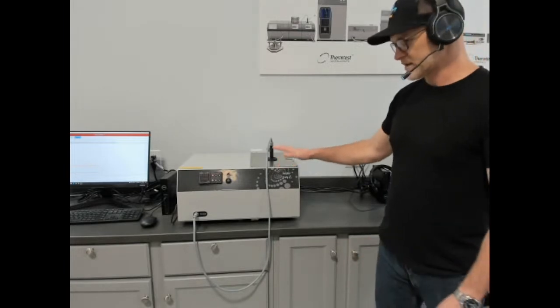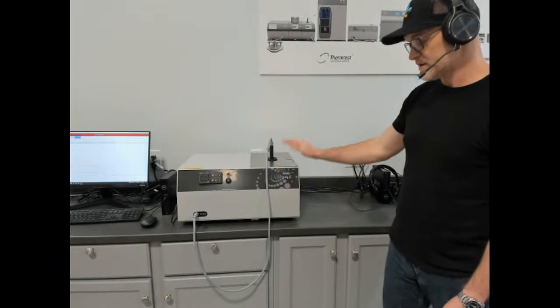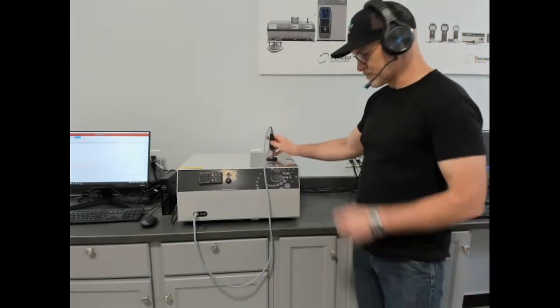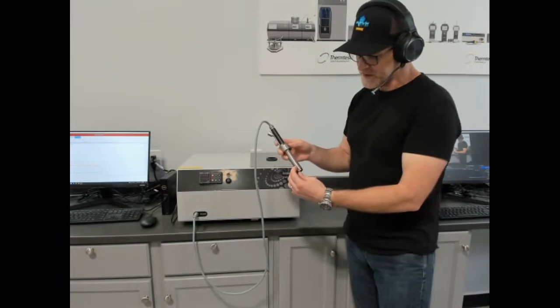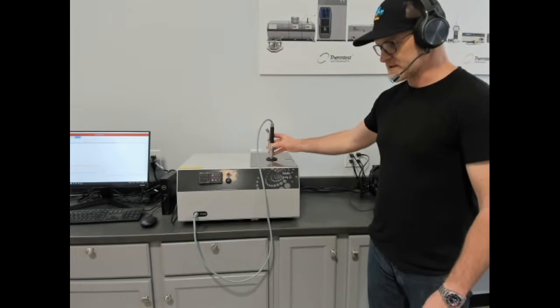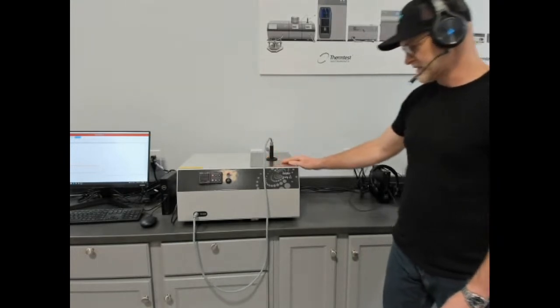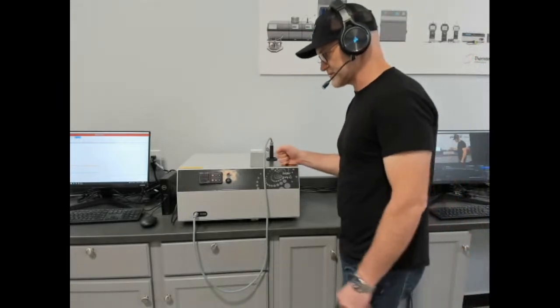So again, thermal conductivity, thermal diffusivity and volumetric specific heat of liquids. And phase change materials. Why phase change materials is because there's a special cell that you can acquire with your instrument to account for change in volume so that your sample stays in contact with the testing wire. So it's a really good instrument, really focused on liquids and phase change materials.